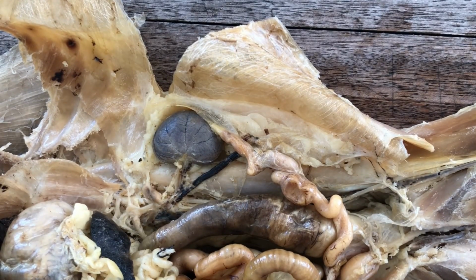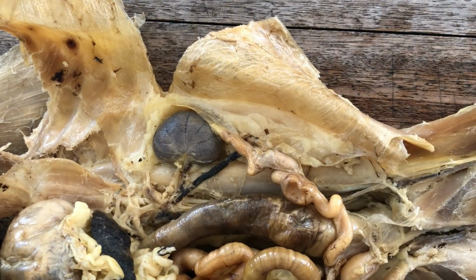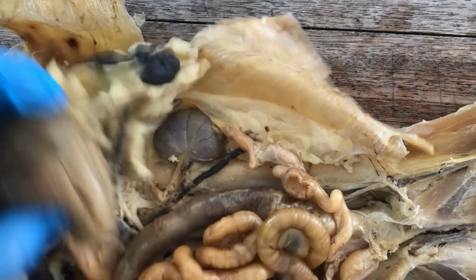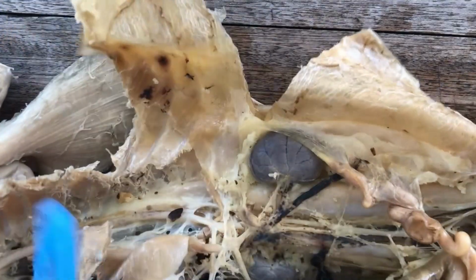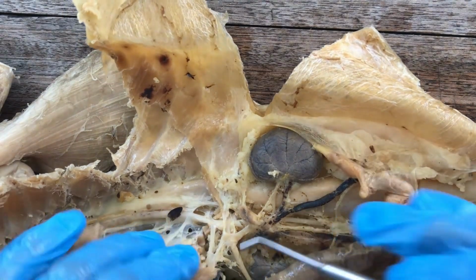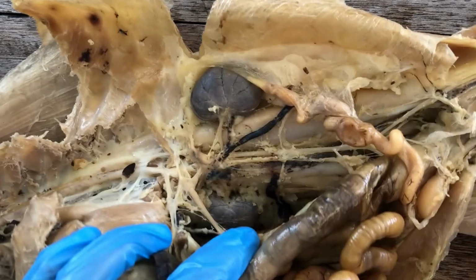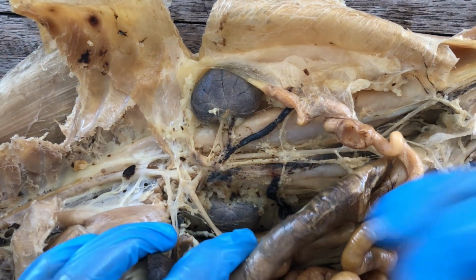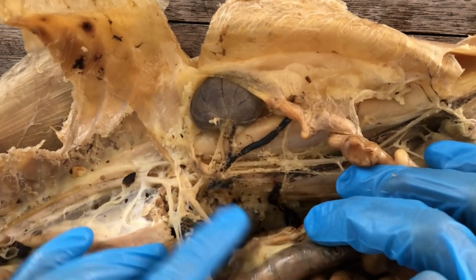I'm going to run through the median visceral branches of the abdominal aorta, supplying blood to the unpaired digestive organs here. So, abdominal aorta. There are immediately three huge median branches, or arterial trunks, of the abdominal aorta going to the viscera.